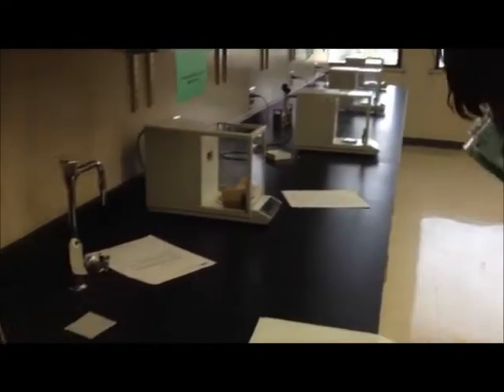Clap, good. Action. Alright, start by zeroing out the scale to make sure everything's right.